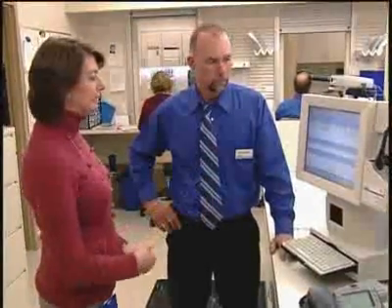So Debbie, we've spent quite a bit of time talking about telepharmacy and SP Central. It seems that you like the product a lot. Can you kind of just tell me some of the key components that are really helpful to you? Yeah, I like it. I don't have to go in and interrupt the technician to find out if they're working on a particular prescription or not for a particular patient. I can look on the screen. It says it's either in process, it's filled, or it's still pending. I like that. That cuts down on interruptions for them.